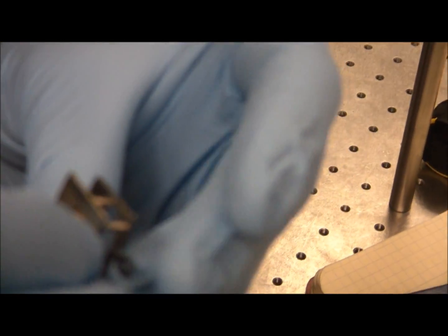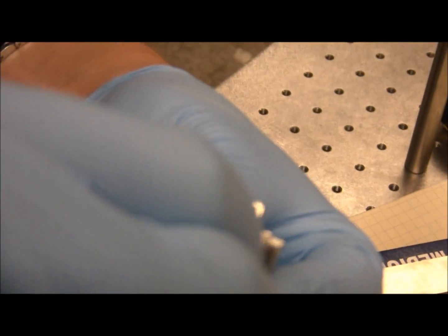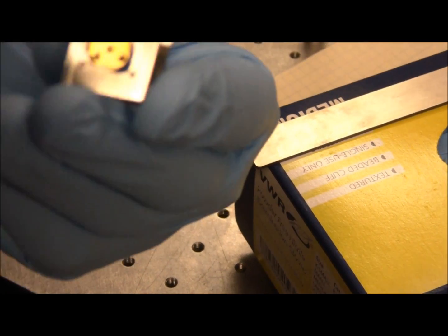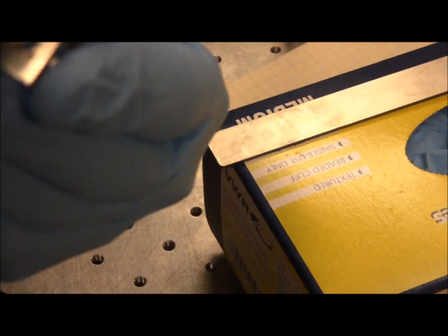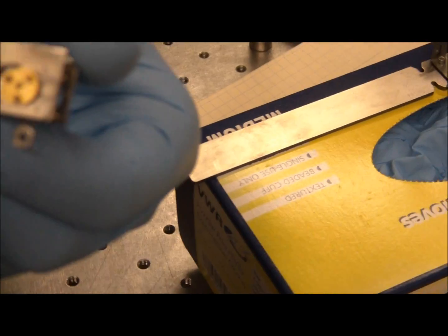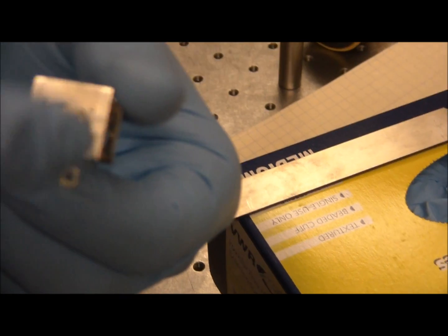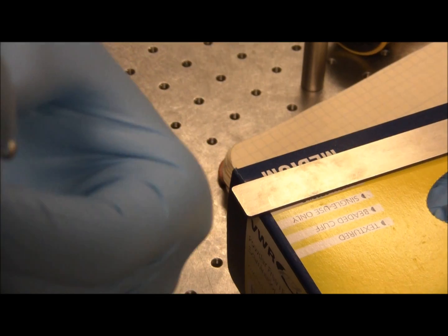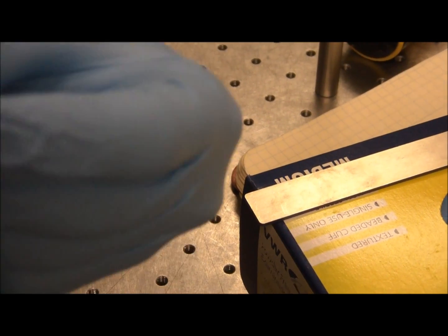So we'll put it in. It's also important to note that the ring was at the top for that orientation — the sample holder grasping piece. This part of the sample plate was at the top, so it wasn't like this, because this is also backwards. So: ring at the top, tripod legs — two at the top, one at the bottom.